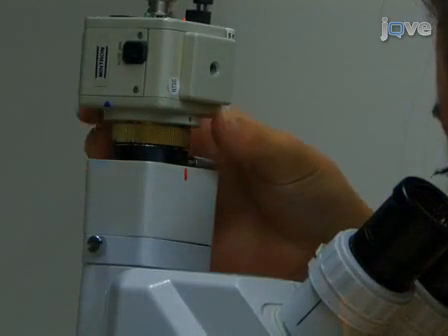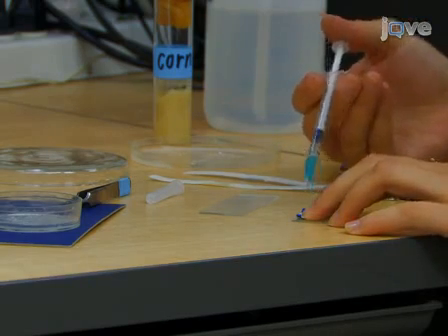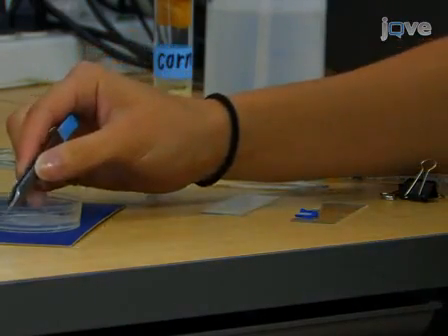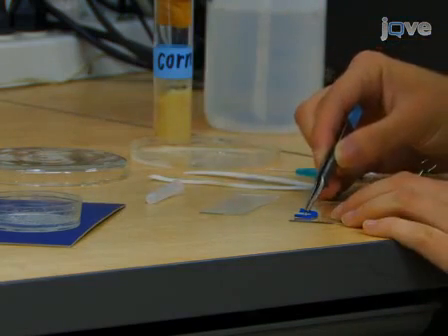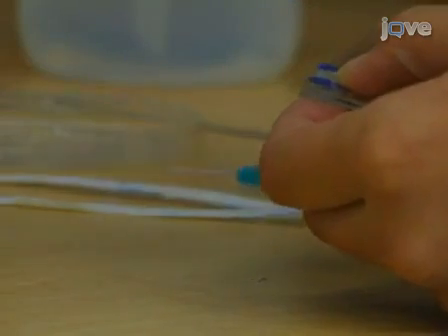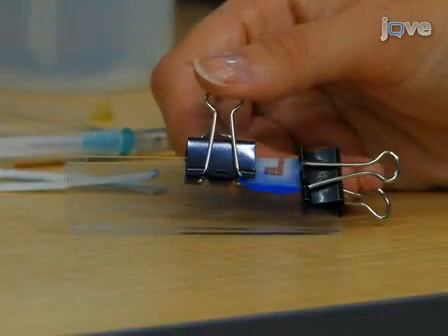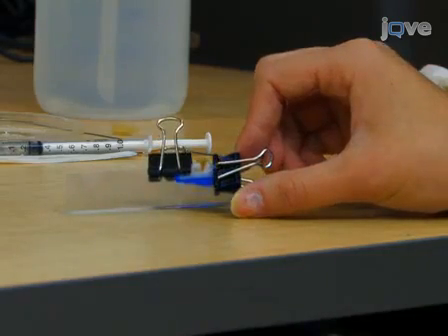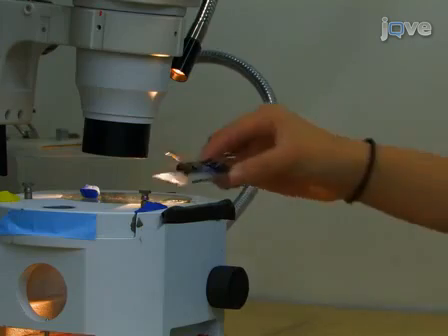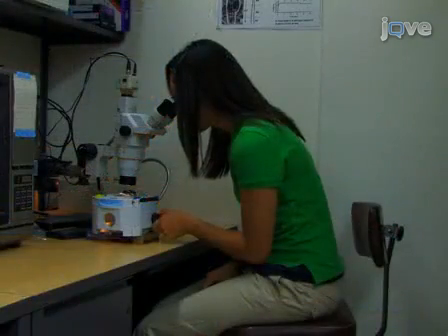Photographs and videos can be recorded through a camera on a trinocular mount. To begin this method, sandwich a larvae with a thin layer of food between two glass slides. The slides are held 1 to 1.5mm apart with plastic spacers on all four sides. Tilt the preparation between 20 and 45 degrees for a few minutes to encourage the larvae to keep its head pointed downward. Adjust the microscope mirror for best contrast of the heart or the two trachea to watch the heart beat.